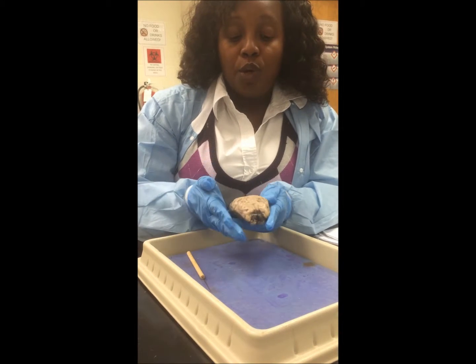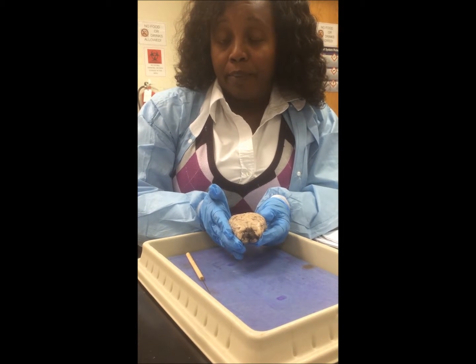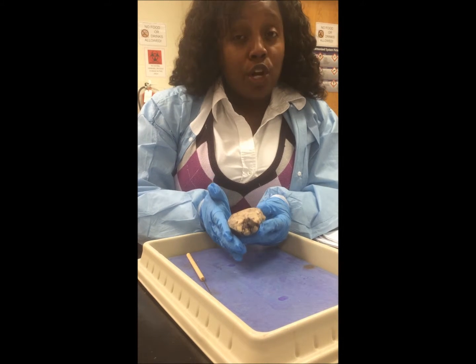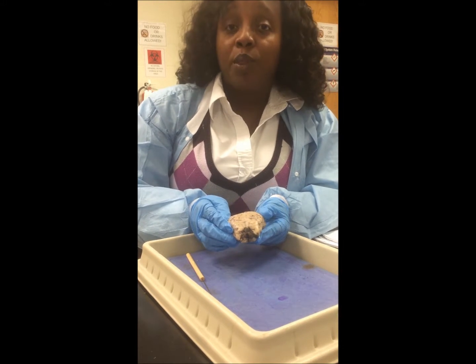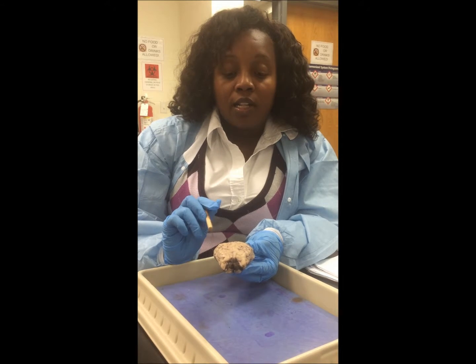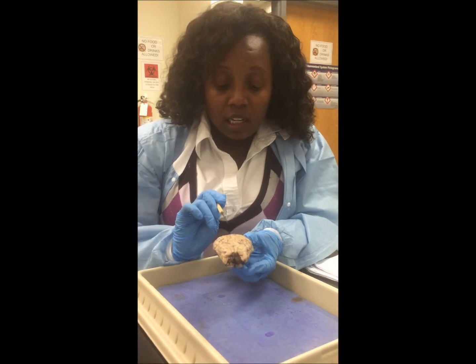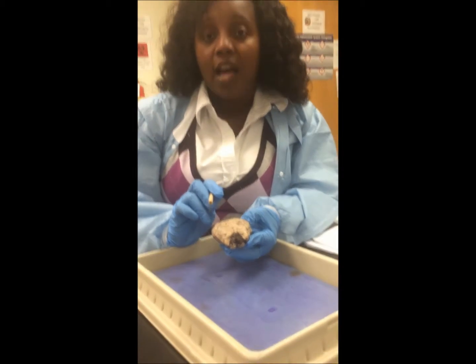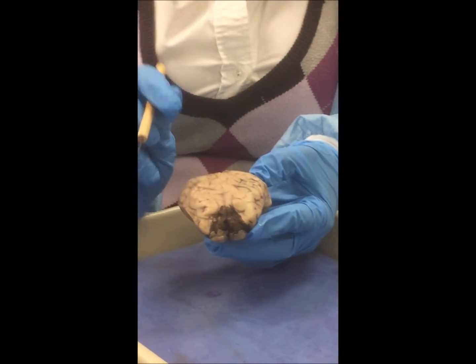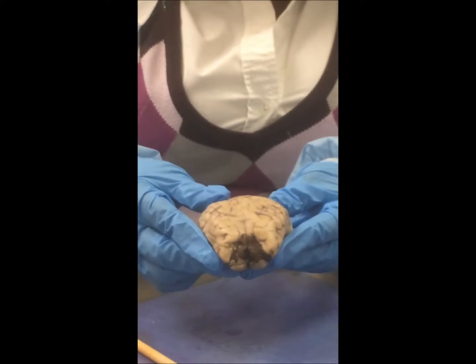Now, when you look at your brain, you're going to also notice the different meninges. There are going to be three different types of meninges that you're going to be looking for. The first one is going to be the dura mater, which is the most superficial meninge of the brain. You'll note that you do not have that on this brain because it was removed when the brain was being removed out of the cranial skull. Second layer is going to be the arachnoid mater. That is going to be conducive to seeing all the small, spider-like capillary veins throughout the brain. And lastly, if you can pick it up, is the pia mater. This is going to be the deepest and thinnest meninge on the brain. All of these protective coverings of the brain give the brain some protection from the skull.